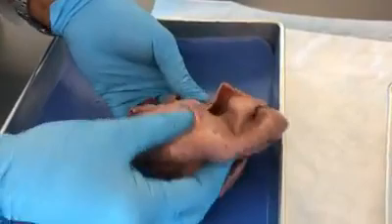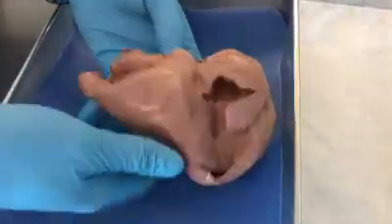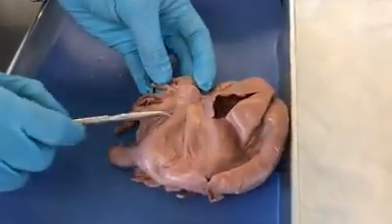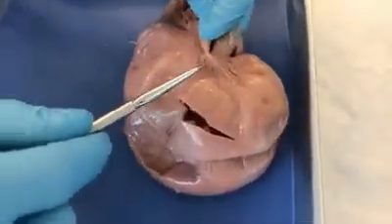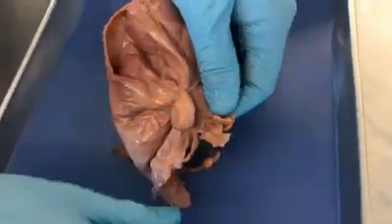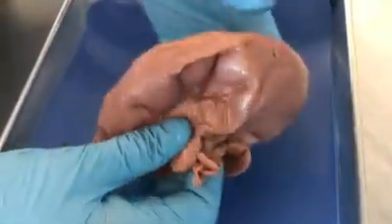So we see the uterus and the cervix and the ovaries, which you see here, they're all connected to this broad ligament. So this is the broad ligament, and if you notice, the ovary is connected to the broad ligament by this ovarian ligament here. And I just want to point out the other ovary here, and this is the ovarian ligament as well.